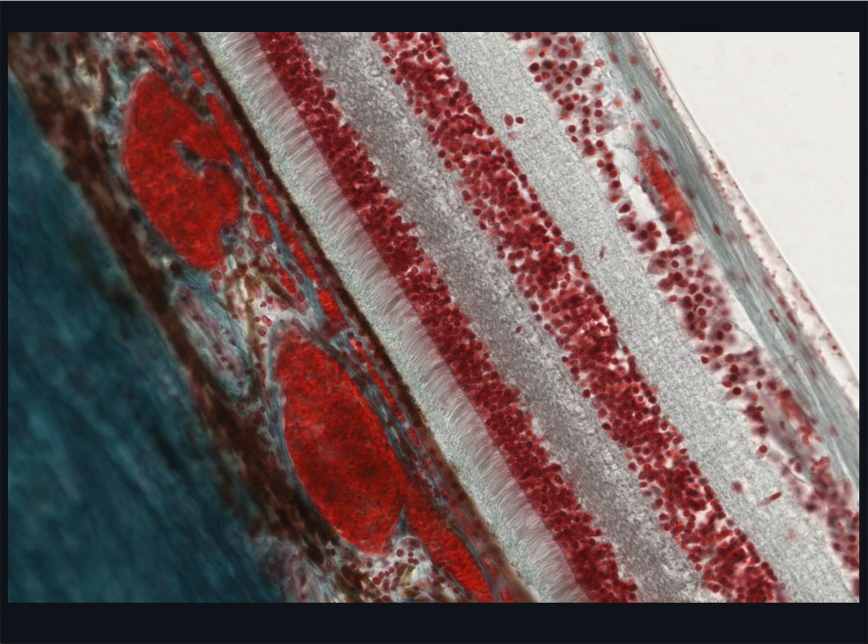Adjacent to this inner nuclear layer is another whitish region of synapses called the inner plexiform layer. The nuclei of ganglion cells are arranged in another layer called the ganglion cell layer, and the axons of the ganglion cells form the nerve fibre layer. And finally, there is the internal limiting membrane, which is the external basal lamina of the Muller cells or glial cells lying closest to the vitreous. The axons pass out of the eye as the optic nerve.